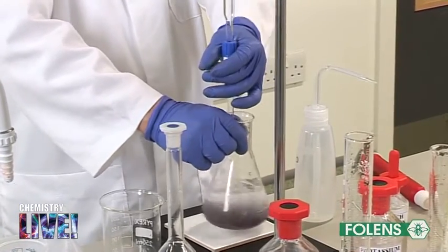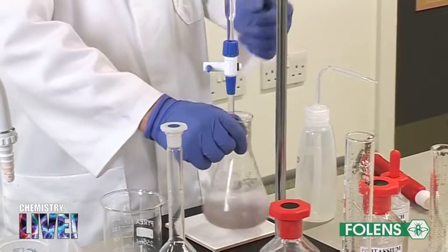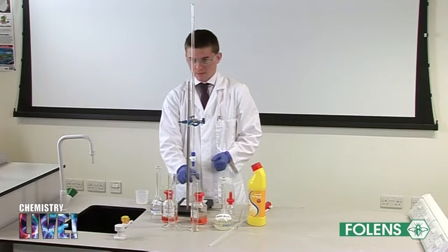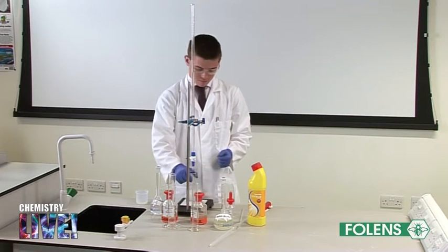Continue the titration adding the thiosulphate solution drop by drop until the blue-black colour disappears to give a colourless solution.